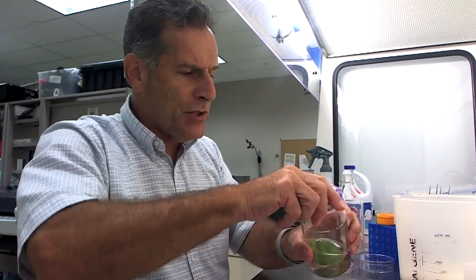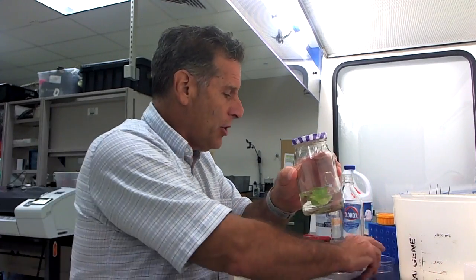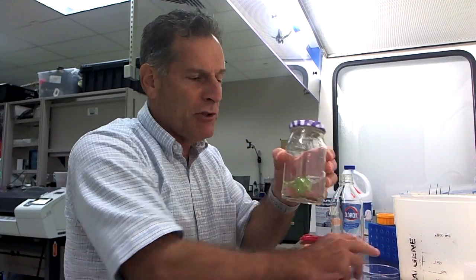There's no soap suds that foam. I don't want to get too close to it, but there's also no smell, no odor of bleach that's left. I think we're ready. What I'll do next is take these capsules, put them in these petri dishes, open them up, and see what we got.